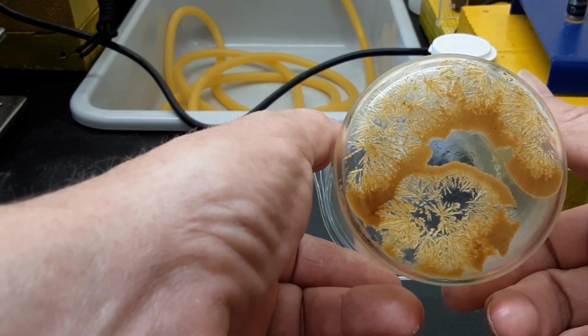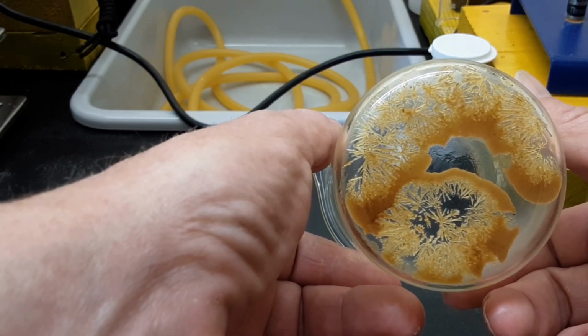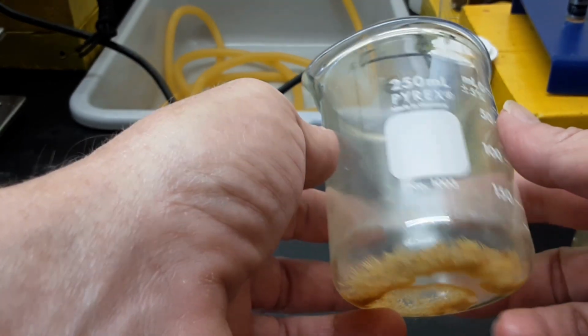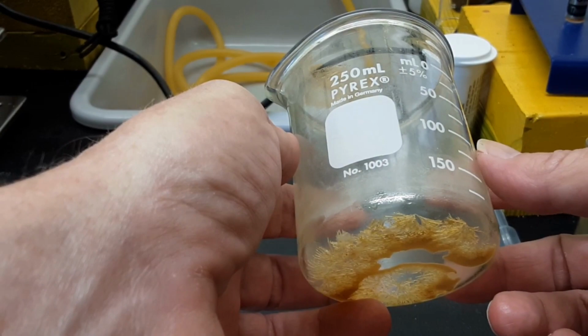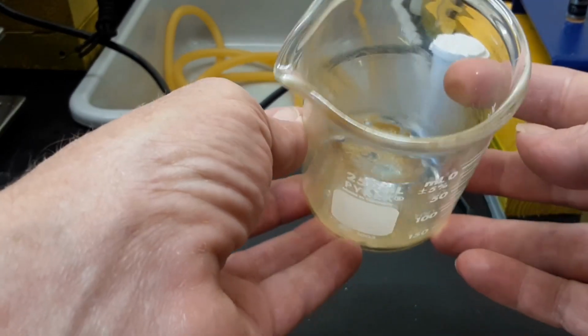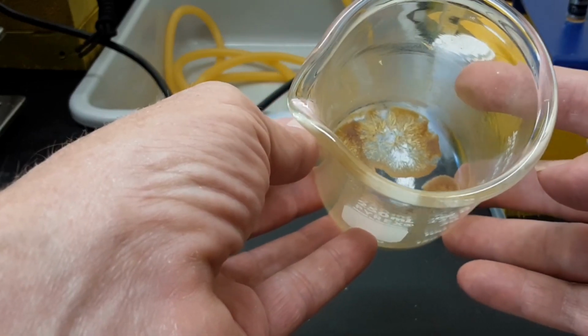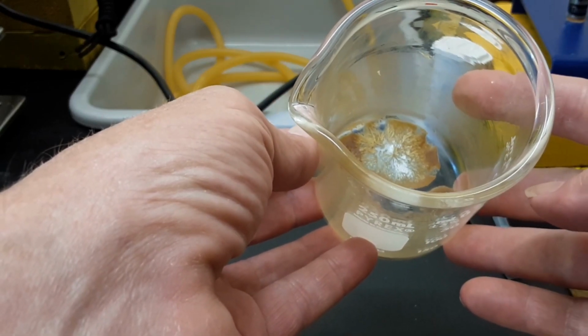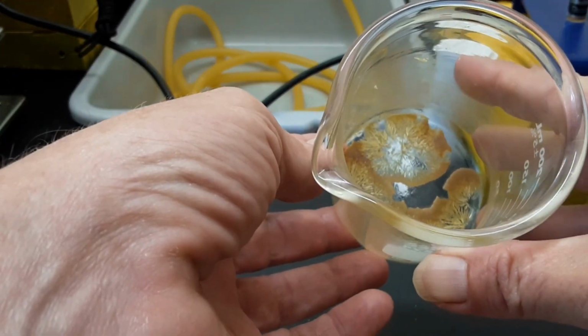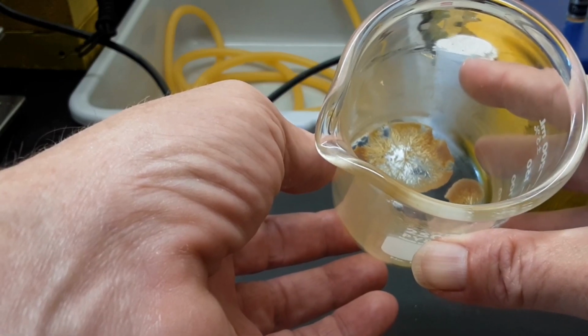This thing would not crystallize for nothing. I did it 3 or 4 times with acetone. I did it one time just to prove that I wasn't insane with ethyl acetate. And then after that, I just went over the edge. So I dumped a whole pile of cold acetone into it, swished it up, and dumped all the brown out of it. I did that about 3 or 4 times.